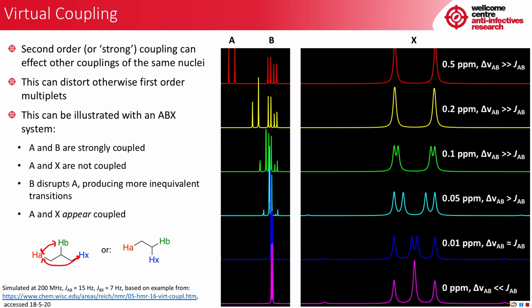But I think it's easier to show you this with an illustration. So here we have A and B. Their signals are 0.5 ppm apart. This is much larger than the J value, and you can see a little bit of roofing, but that's about it. And you can see the signal for X is a nice doublet, and this is the BX coupling. Now, as we move to a gap of 0.2 ppm, we can see that this roofing is much more pronounced, but again, we still have a nice doublet just for BX coupling here.